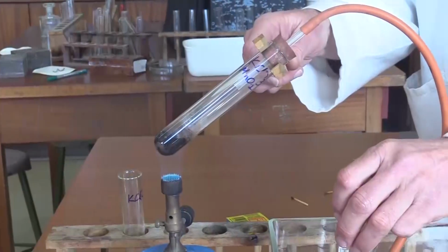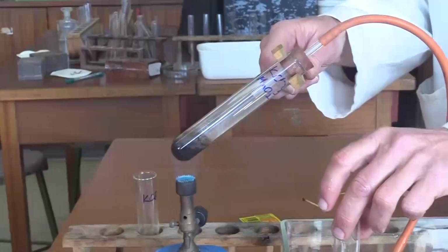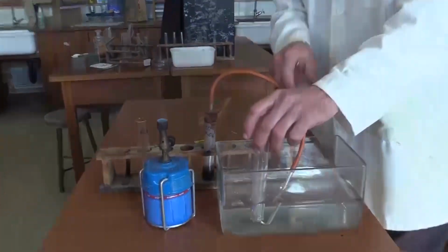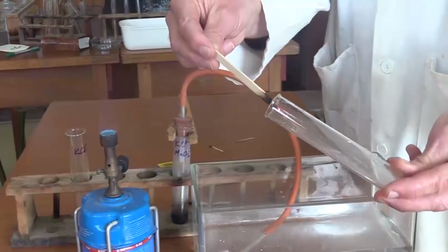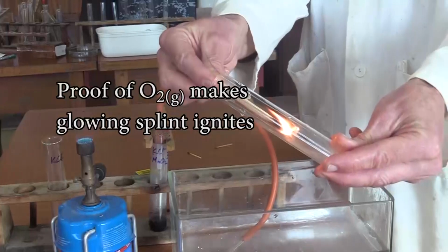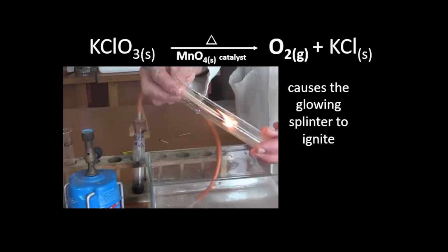So we're repeating it now, collecting the gas in a test tube, and once the test tube is full, we test it with a glowing splinter, and this time there's enough oxygen for it to ignite, proving that the gas is in fact oxygen that was released when the potassium chlorate was heated, and the residue is potassium chloride.